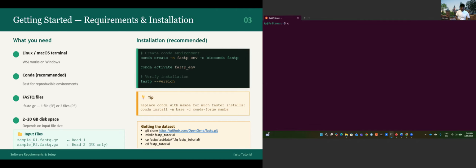Let's try to do it. We use conda create -n fastp, where fastp is the name of the environment you are creating. It can be other things; it does not need to be exactly fastp. But what is required is conda create -n, the name of the environment, and -c bioconda fastp. I will not run the first line because I already have it installed, so I will just activate it to be able to work with you. If you haven't used the Conda package manager before, you do need to use the first line to install fastp.